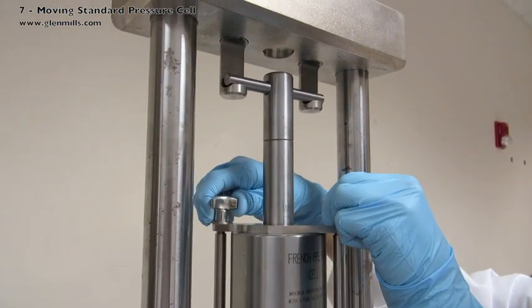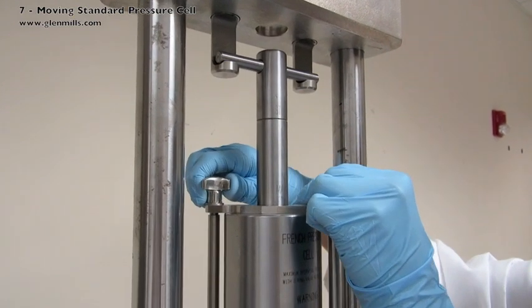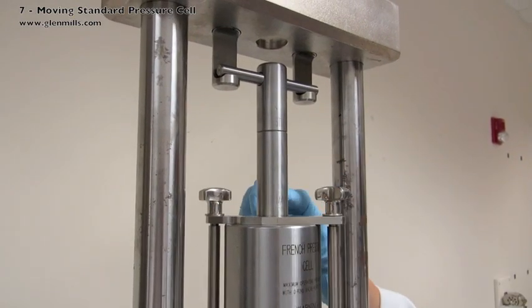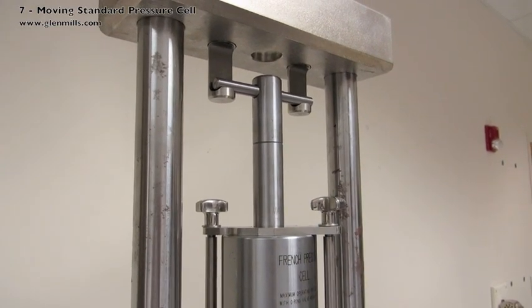Be sure the metal brackets are not touching the piston or it can scratch it. Be sure the small screw on the cell body is not underneath the safety clamp but in the back. Secure down by tightening the two thumb screws.